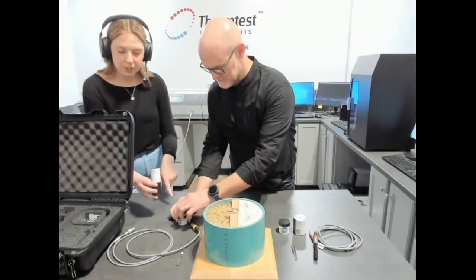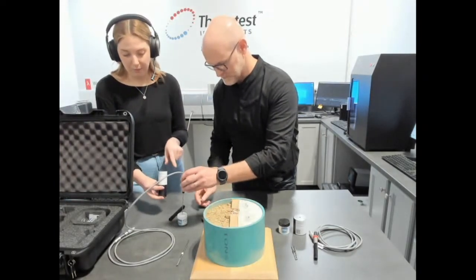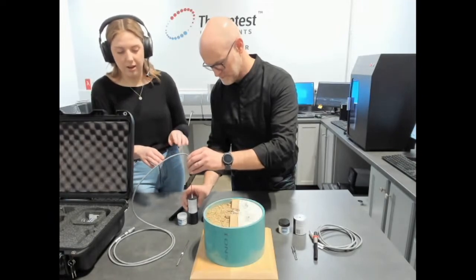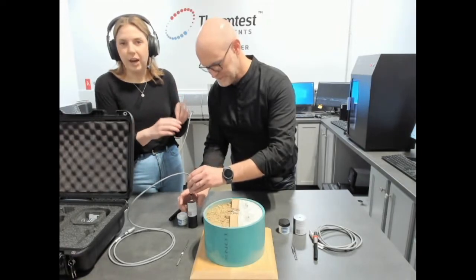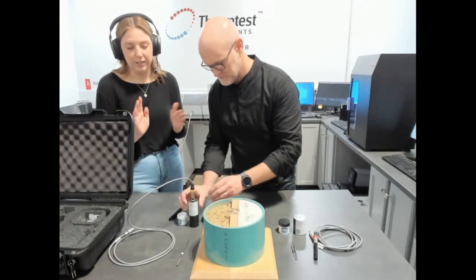We're going to take our protective sheath off and first dip our TLS 100 needle in the thermal paste — just dip it in and get a good amount on the tip of the needle — and then insert it into the top of our verification sample, spinning as we insert it, to make sure we're coating the entire needle for good contact between the sample and the sensor.